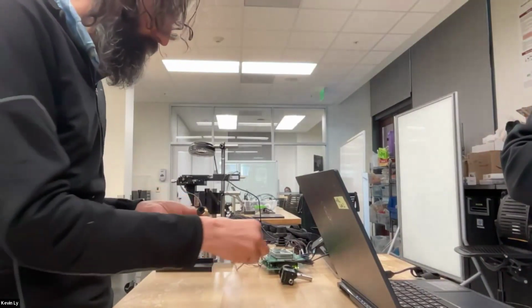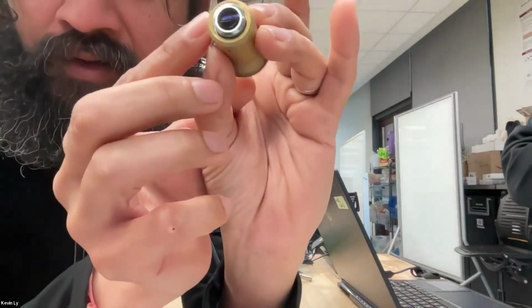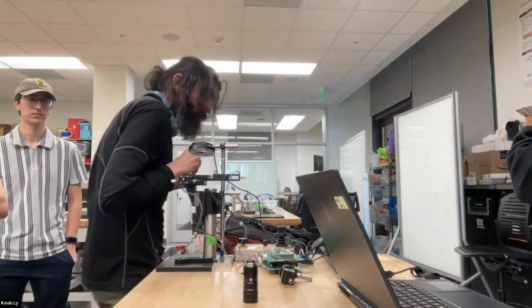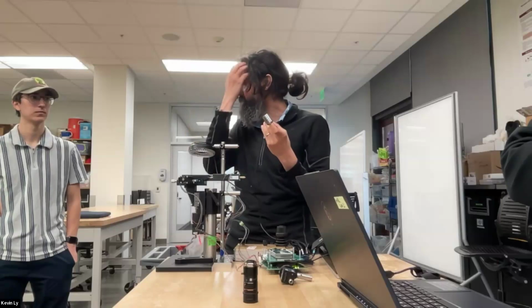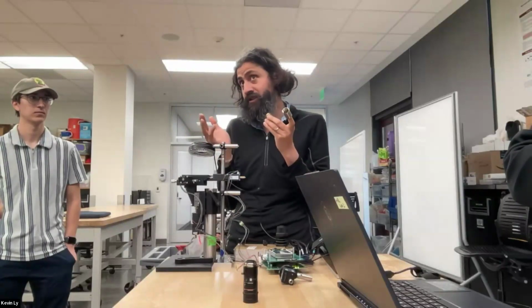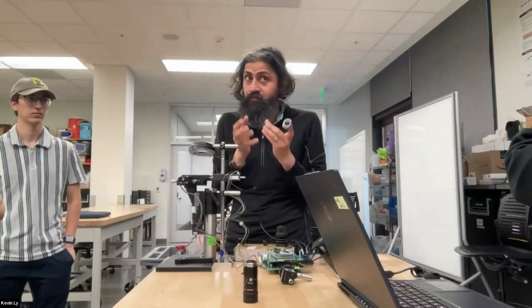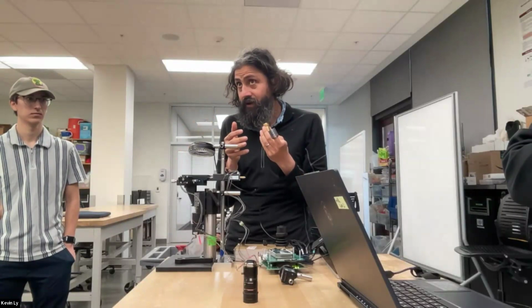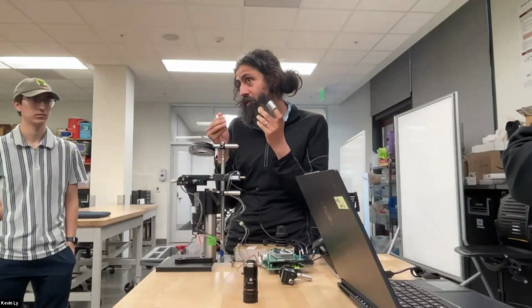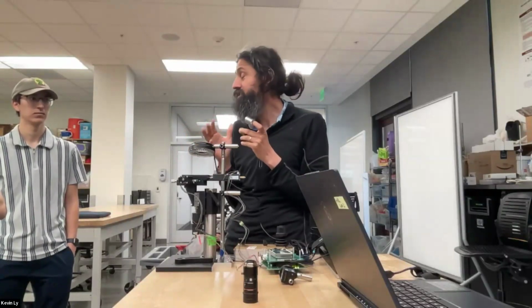Why is that? You can see sets of parts here, but stacked inside, if you were to cut a cross section, it depends on what you're trying to do with an objective. First of all, everybody remembers the laws of refraction. They're dependent on color, wavelength. So if I'm trying to make an objective for a color camera, I need to have the same image form at the same point for all of these wavelengths. So color correction, which is called chromatic aberration, is actually super hard.